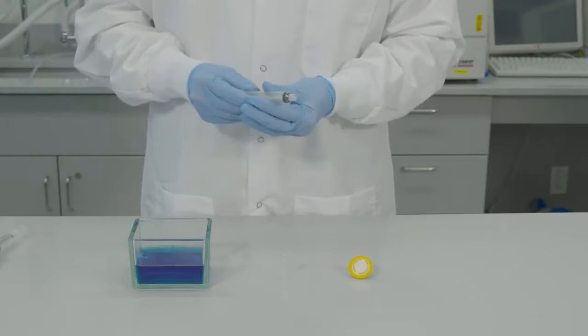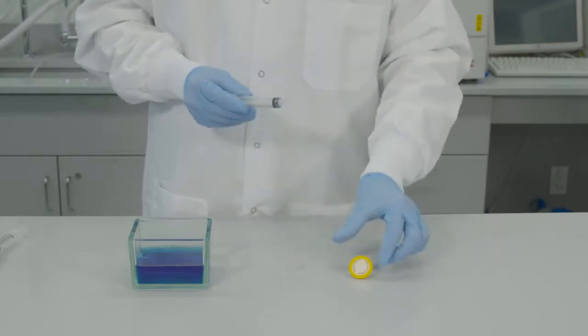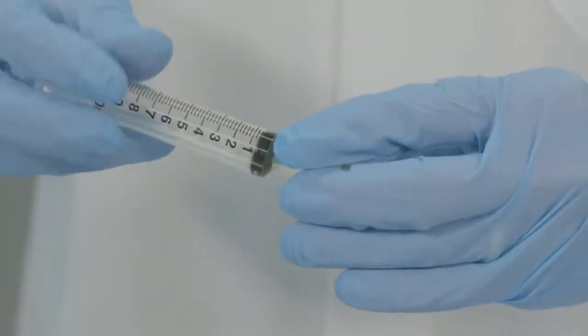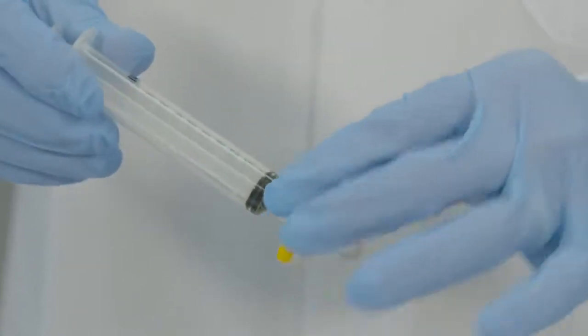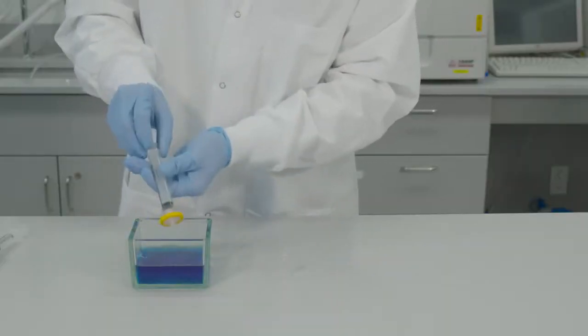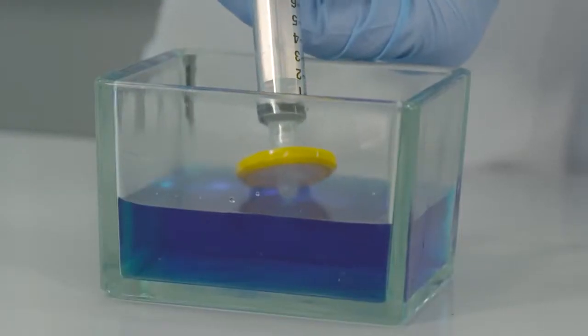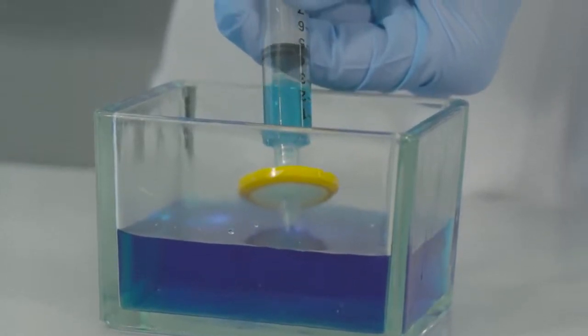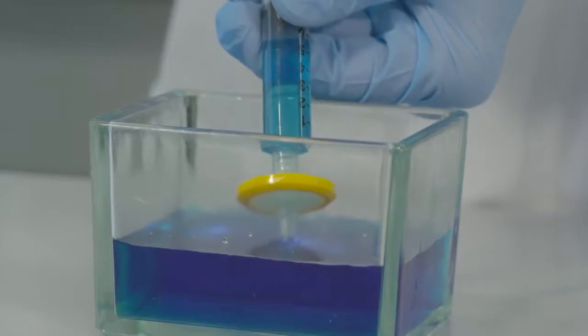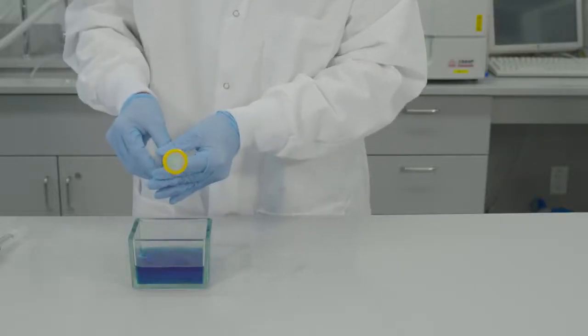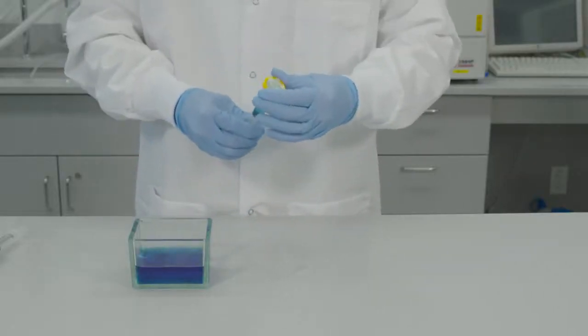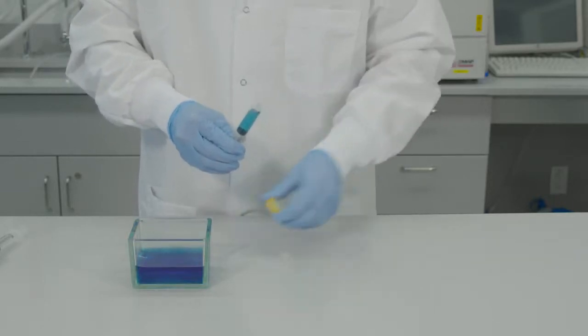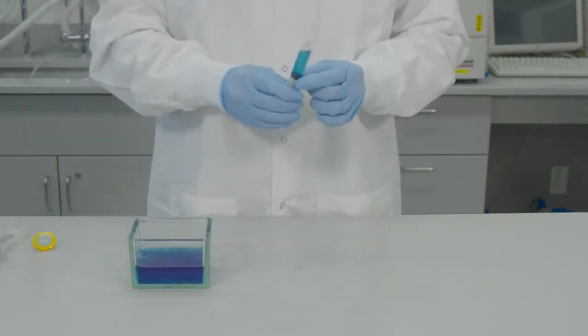The second way of using a bi-directional syringe filter is to attach a syringe filter to a syringe. Pull liquid from a tube through the syringe filter into the syringe. Remove the syringe filter. Liquid in the syringe is now filtered.